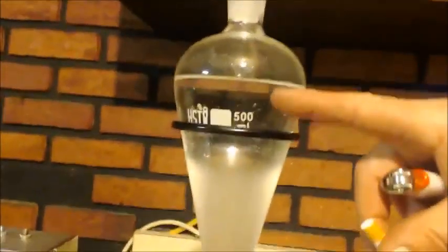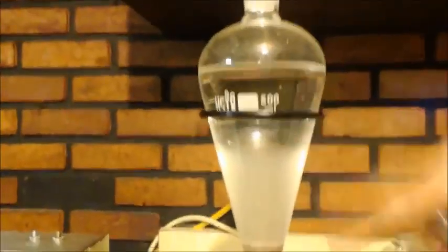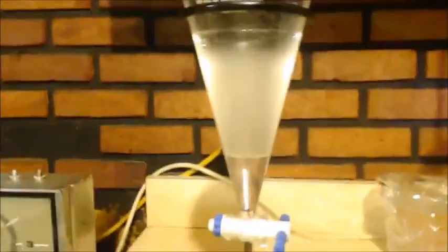Well, you can see it's clear on the bottom there. There's the line. Doesn't look like a bad yield. I figure I only put like 60 milliliters in, so it's clear on the top. I'm just waiting for the middle part to get nice and clear.